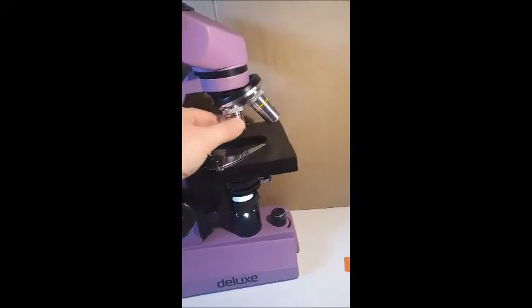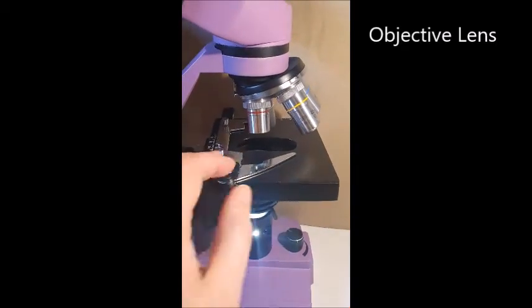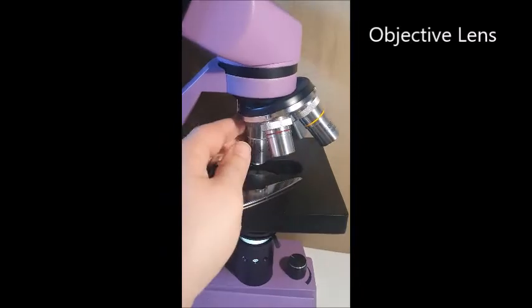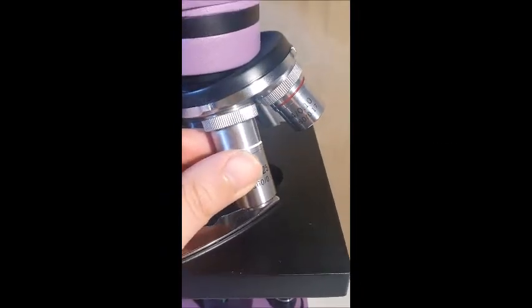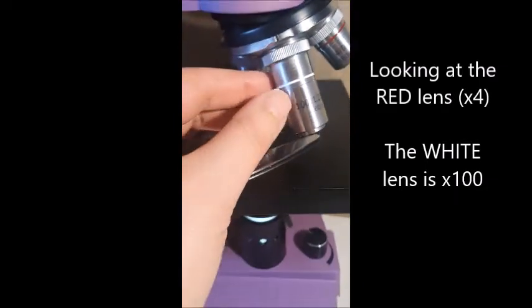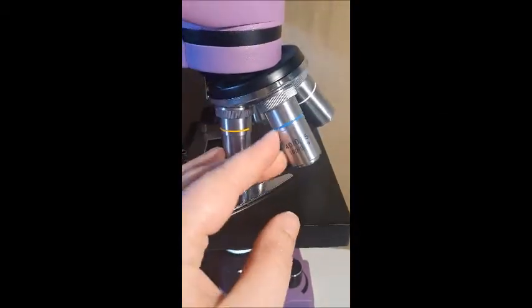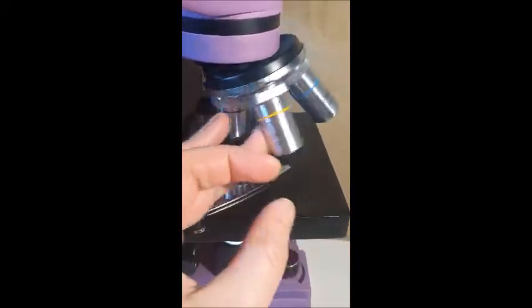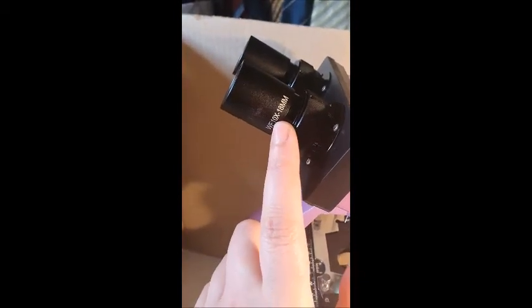Now, if we look over here, we've got four lenses. These are called objective lenses, and they range in size. So if you look on them, you can see the magnification. So that one has a magnification of 4. This one has a magnification of 100 times, which is quite big, then 40, and 10. Now, the magnification of the eyepieces is 10 times.